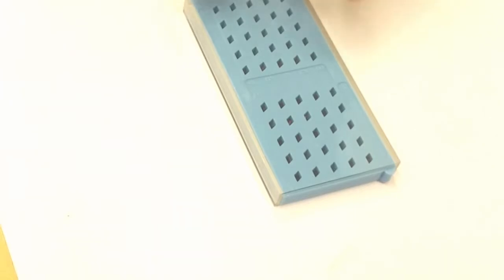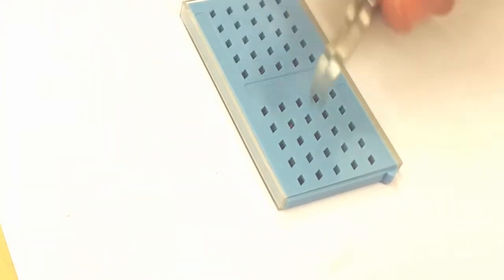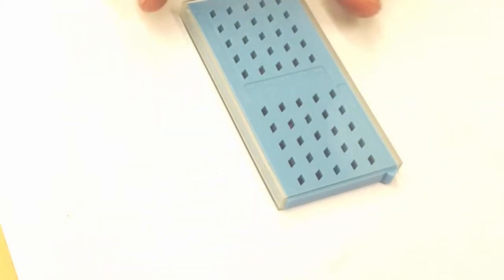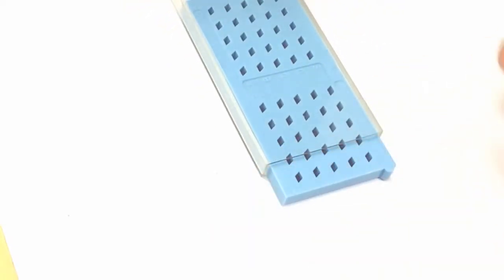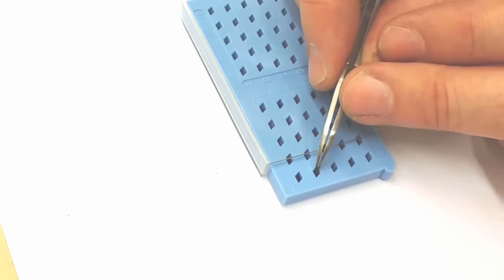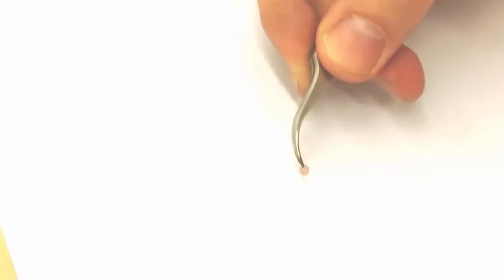When you do TEM analysis, you usually put your samples on small metallic grids. And these grids you buy, and they usually come in a box that looks like this. So here you have several small holes, and in each hole there is a small little of these metallic grids. If you open the box, then you can pick up one of these, and then you can see that it looks sort of like this. Very tiny little dish. This dish is sort of 3 mm across.